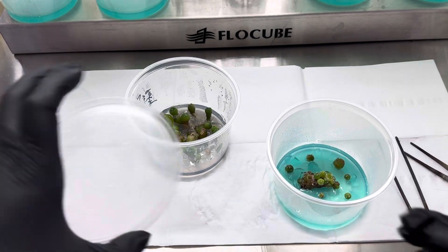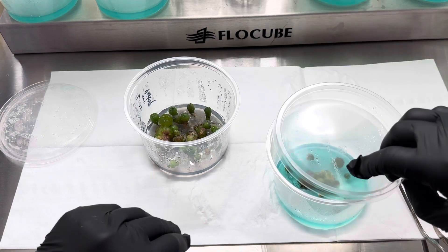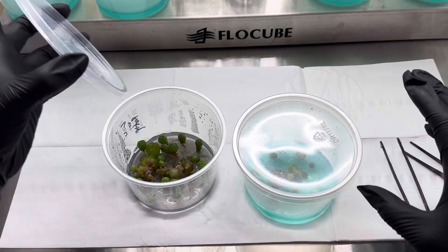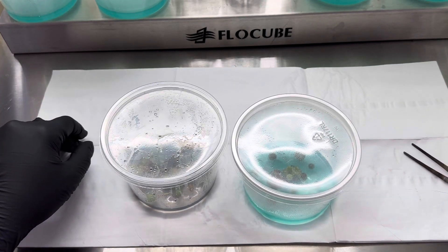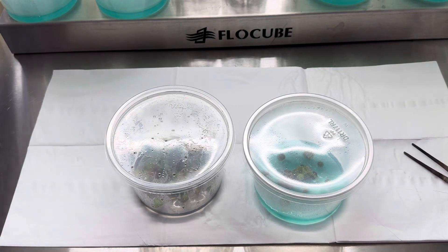We'll leave it just like that. I'm going to go ahead and put a little filter on this and continue to subculture these over on YouTube, but I just like to grab a little filter sticker.